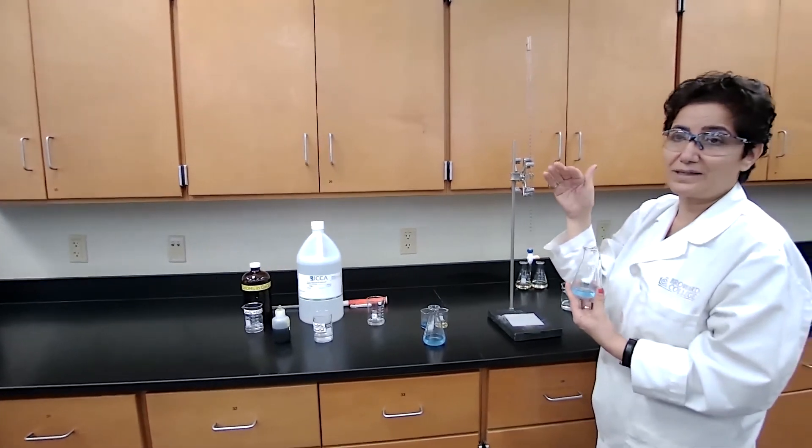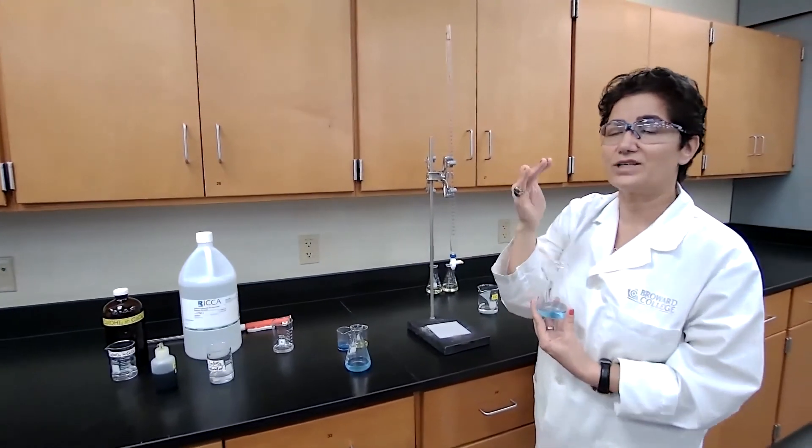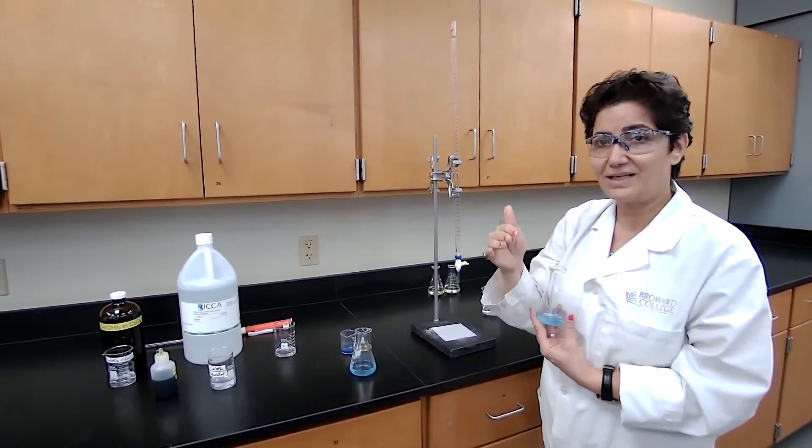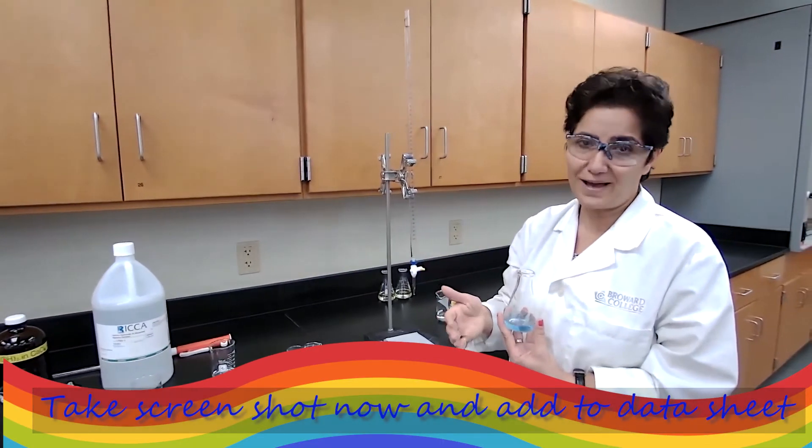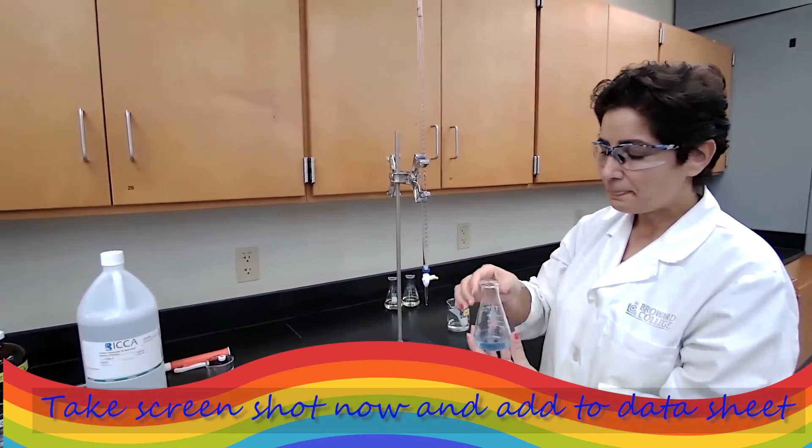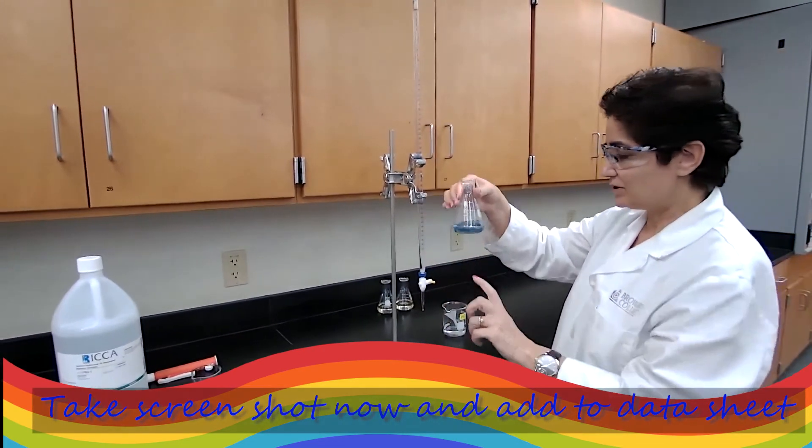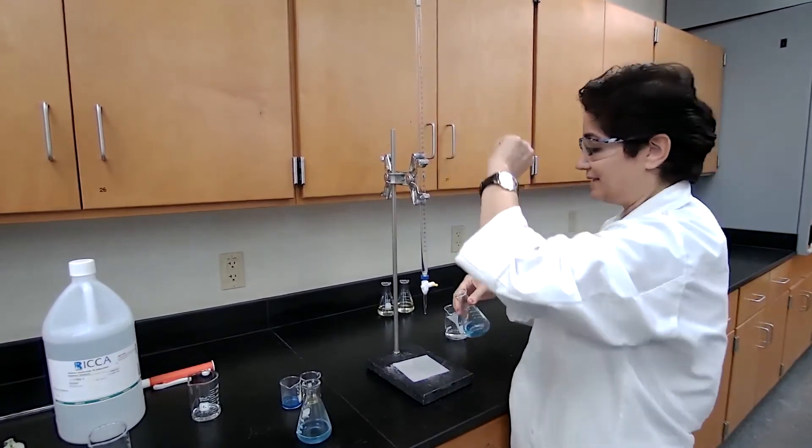That's the calcium chloride dissolved in calcium hydroxide dissolved in calcium chloride solution, which is the common ion effect. That's what we are studying now. So I have the solution base and the acid in the burette.